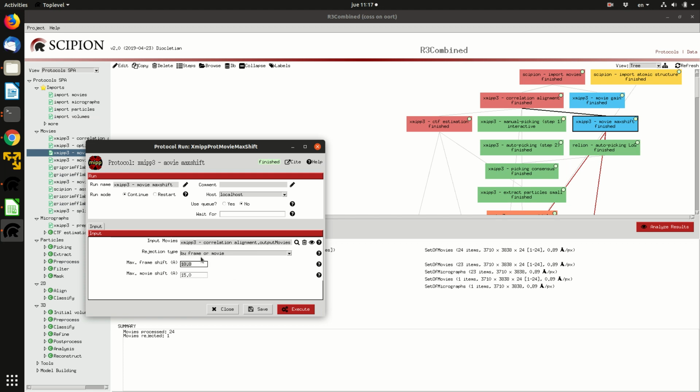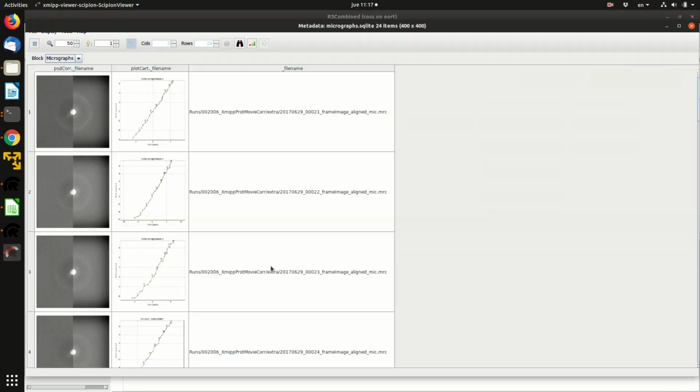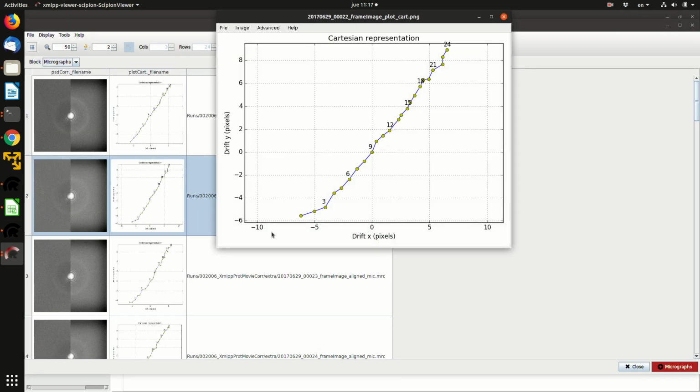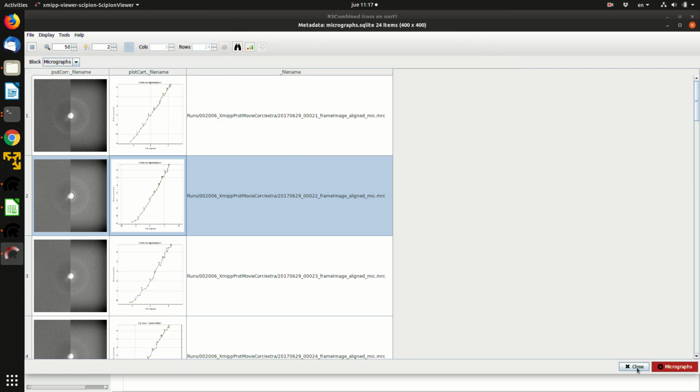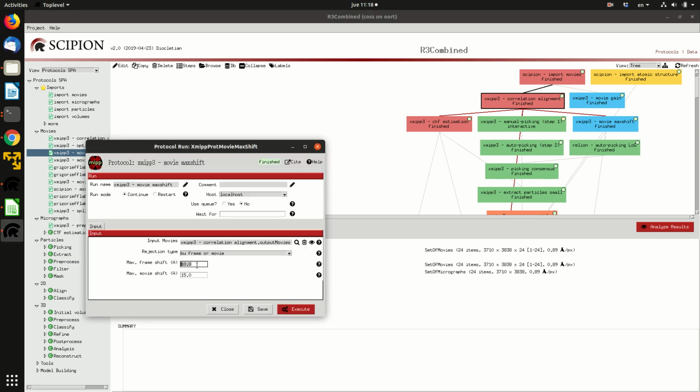So you should discard this movie. The algorithm that was aligning probably made a mistake there. So we can see, for instance, here that the average shifts are normally pretty small, so they are in the order of 1 pixel at most, and 1 pixel at a pixel size of approximately 1 angstrom. So this is 1 angstrom on average from one to the next. So this is a very generous threshold, just to avoid obvious errors.